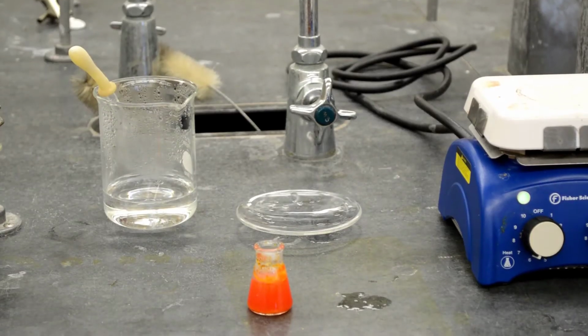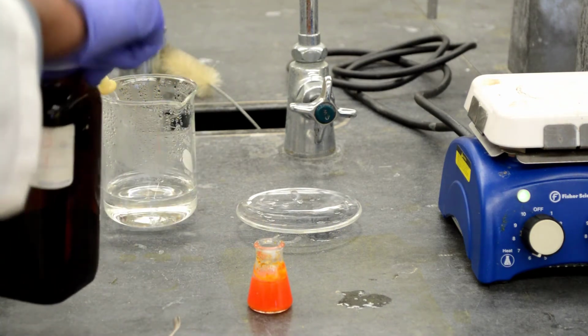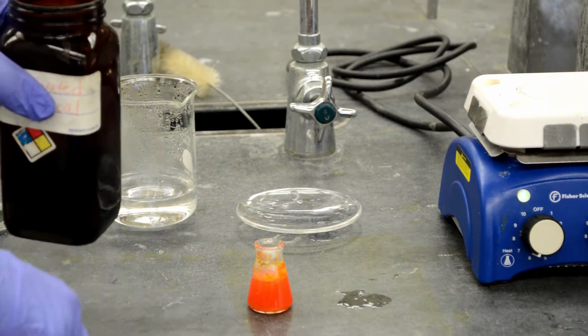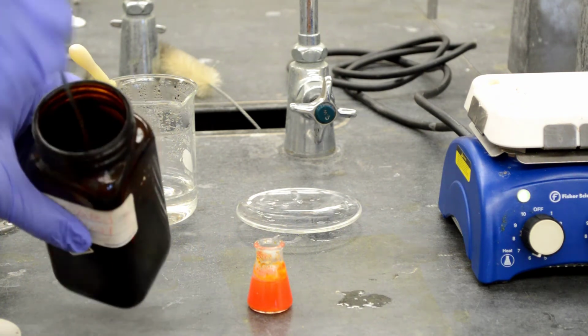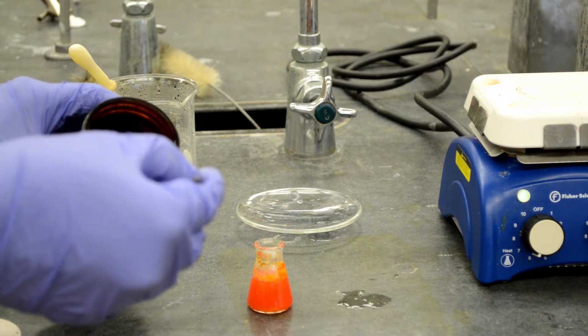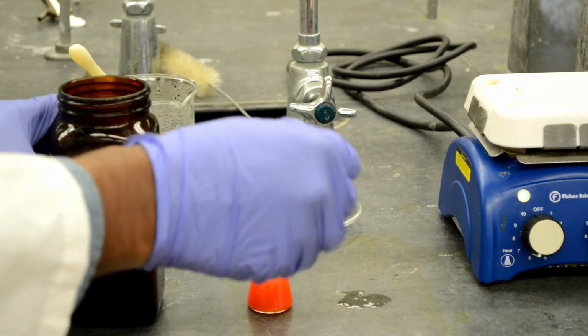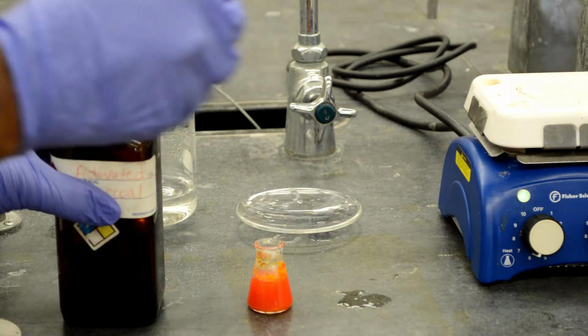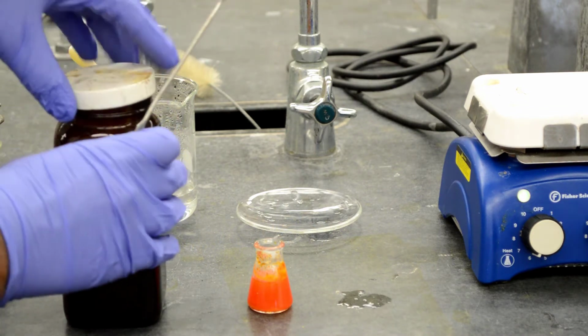We're going to add some charcoal, activated charcoal, to this. So let me add a pinch of activated charcoal. Again, the purpose of that is to get rid of some of the methyl orange impurity. In this experiment, we consider the methyl orange as an impurity, and our acetanilide is our desired compound, so we call that a pure substance that we want to extract.